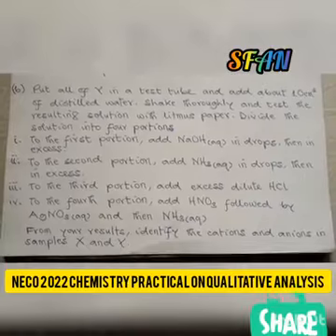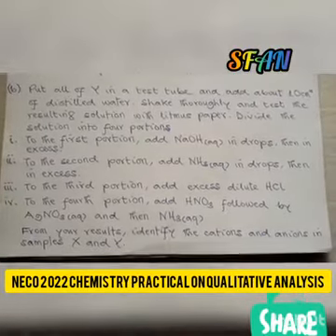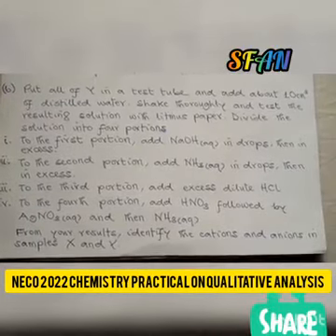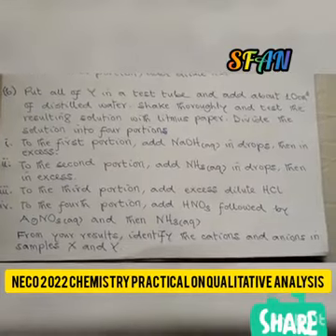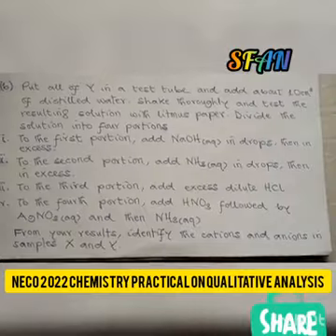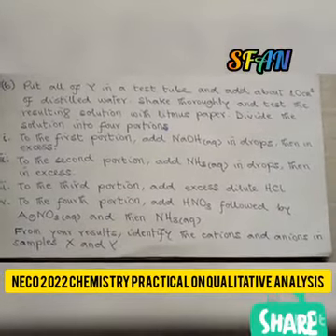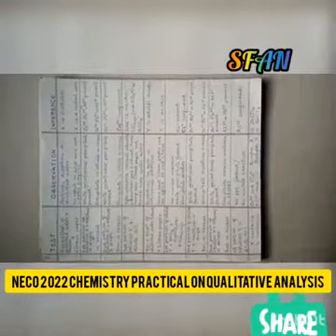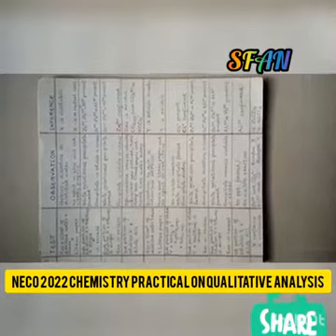To the third portion, add excess dilute HCl, and to the fourth portion, add trioxonitrate(V) acid, followed by aqueous silver trioxonitrate(V), and then aqueous ammonia. From your results, identify the cations and anions in samples X and Y. So at the end of our analysis, this is how our table looks.